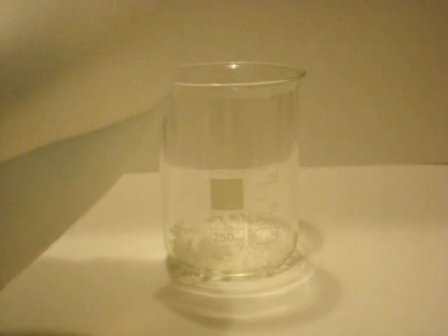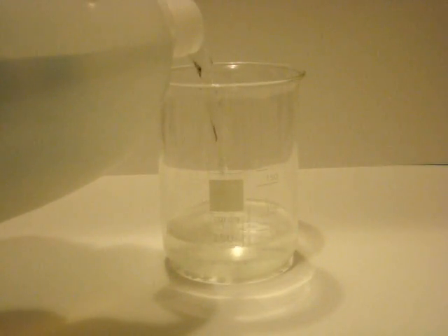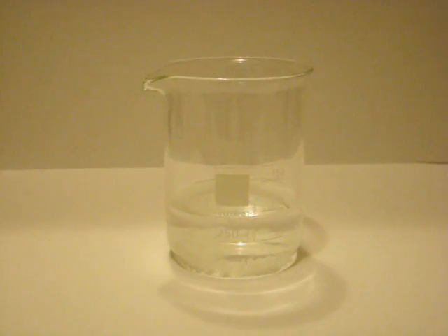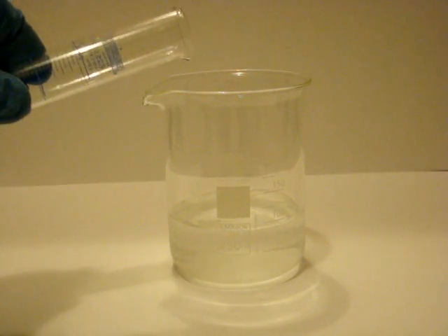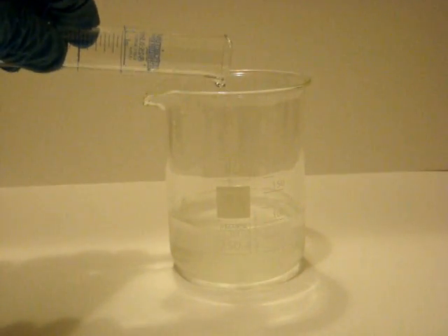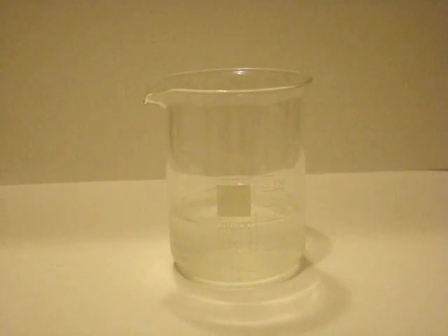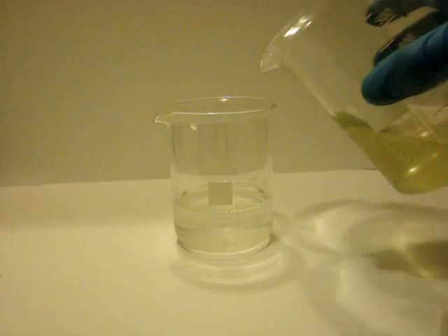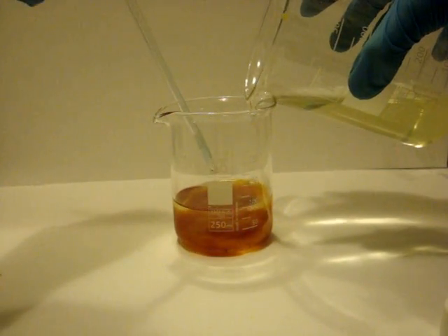Put in a beaker of 250 mL, 12 g of potassium iodide and dissolve it in 100 mL of water. Mix and then add about 4 mL of acetone CH3COCH3. After, just add 150 mL of bleach, a solution of 5% sodium hypochlorite.